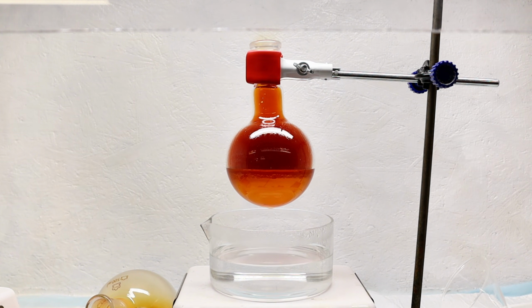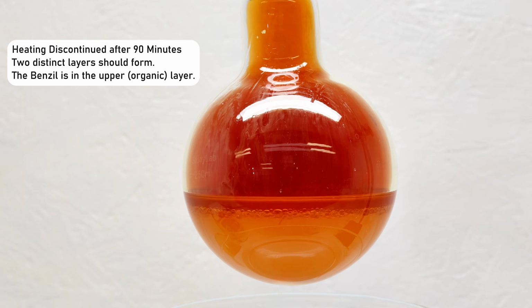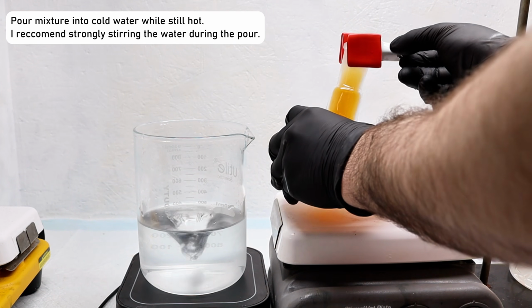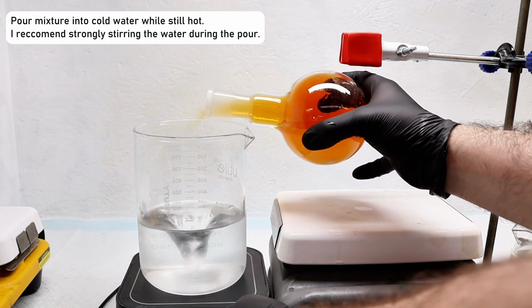This resulted in two distinct layers forming in the flask, an upper organic layer containing the Benzil and a lower aqueous layer. The mixture was taken while still very hot and then slowly poured into a large beaker of cold water. Since Benzil is insoluble in cold water, it'll precipitate out almost immediately.